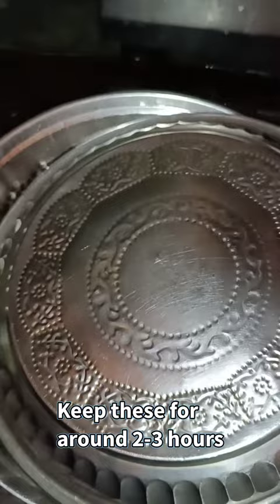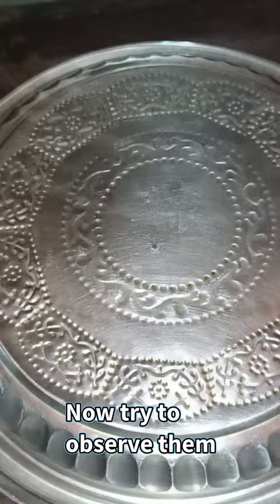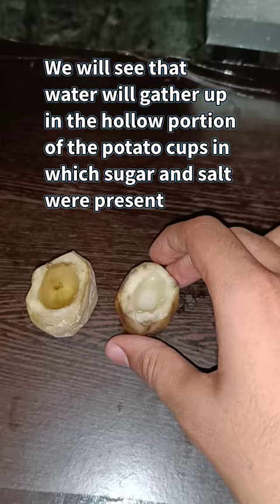Keep these for around 2-3 hours. Now observe them. We will see that water will gather up in the hollowed portion of the potato cups in which sugar and salt were present.